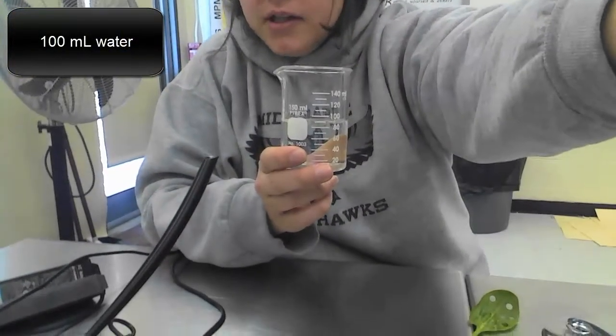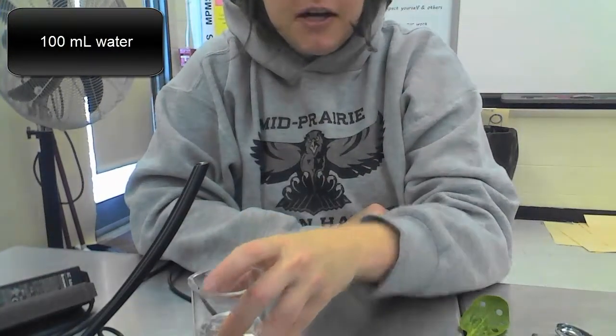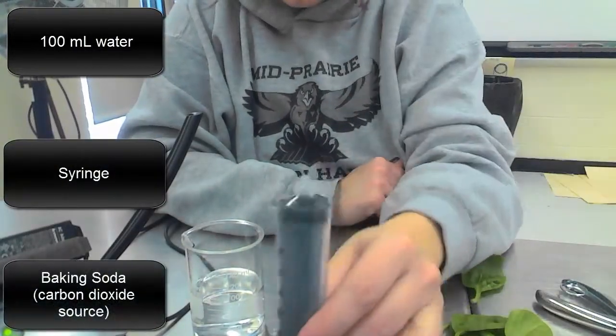Hey guys, what we're going to be doing today is getting ready for our photosynthesis lab. You're going to need to make sure you have several things in front of you when we get started. First thing you'll need to have is a beaker of water, so 100 milliliters. I'm going to go ahead and put it at the table so you can see all my setup. You'll need to make sure that you also have a syringe.